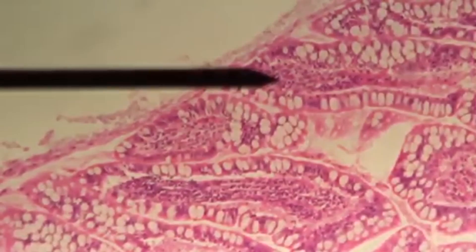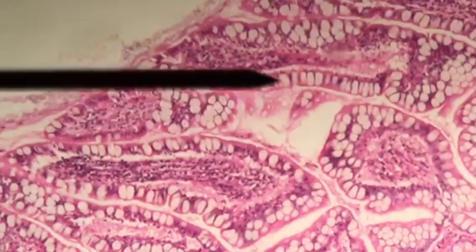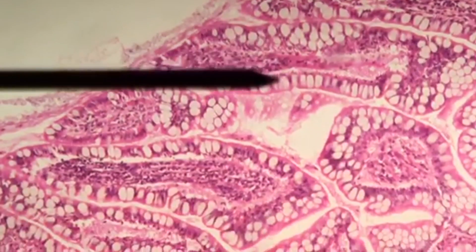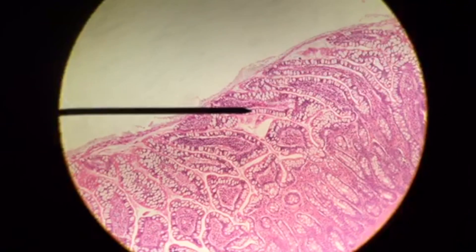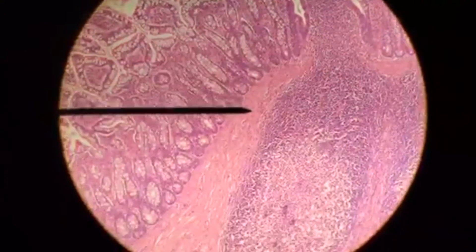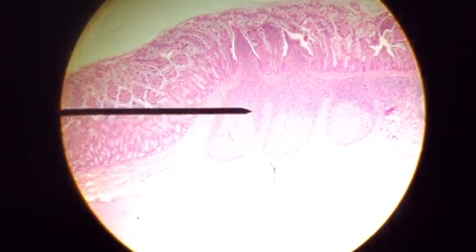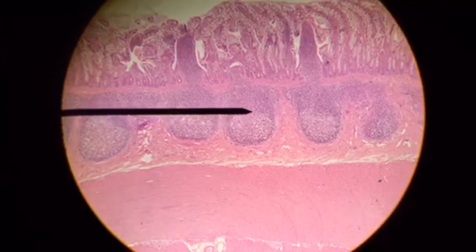Zooming in to the epithelium or mucosa, you can see it is inundated with goblet cells, which help lubricate the intestinal wall and lumen to facilitate movement of contents through the intestine. We see the finger-like projections again, indicative of the small intestine, and our Peyer's patches. Zooming out, we can see the layers with the muscularis below.